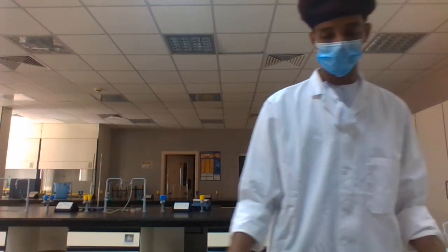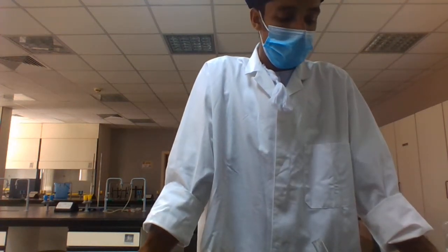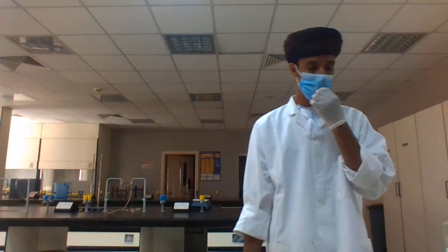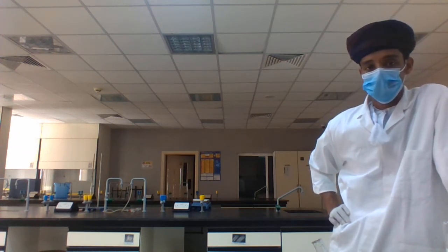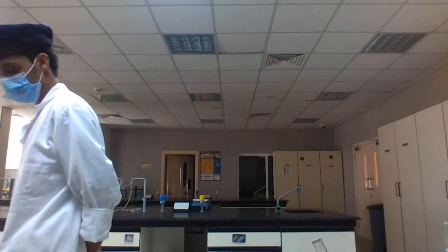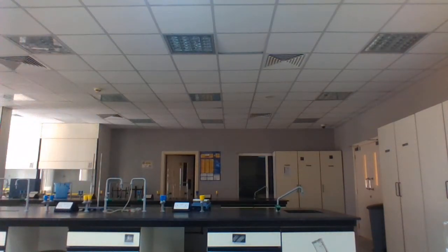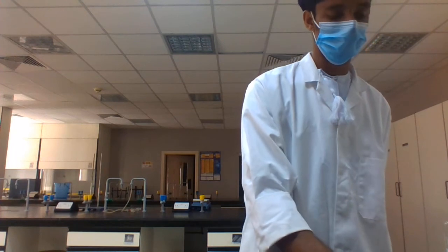And the macromolecules have building blocks, or macronutrients, that are absorbed by the human body in the simplest form. Protein is absorbed as amino acids, carbohydrate in the form of glucose, and lipids in the form of fatty acids. Then we want to test this, and we have 4 samples in the lab. Now we'll do the experiment practically.